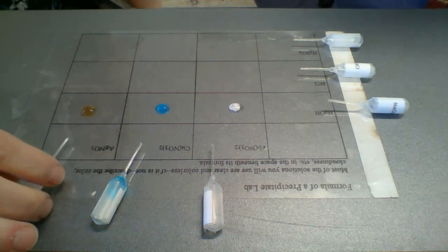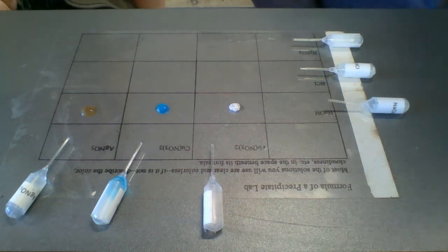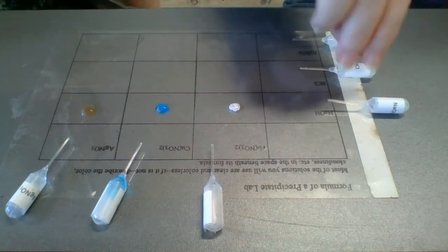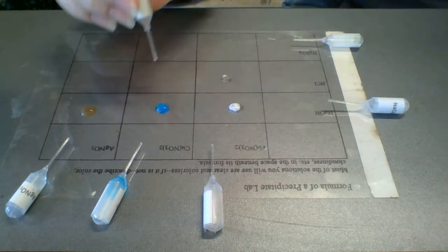Aha! Hydroxides are interesting. We got lots of cool stuff. Might be interesting to look at your solubility chart and see about hydroxides. All right. So we'll go across HCl. Do you want to go ahead and put all of them across? I'll go ahead and do that.